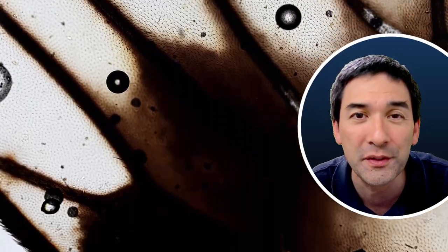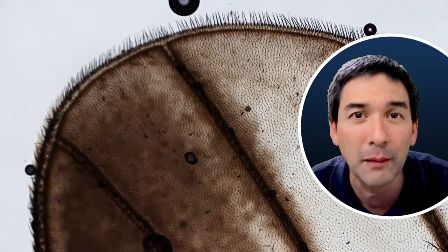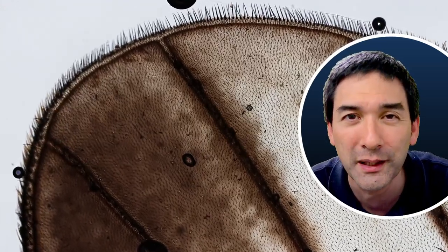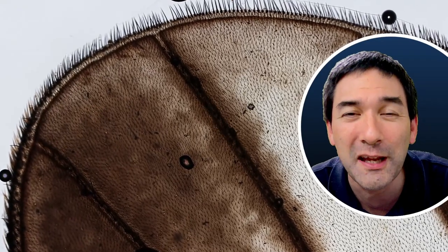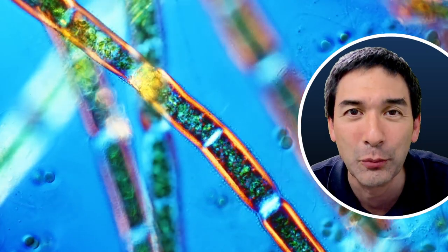Now under my compound microscope this is how it looks and you can see that there are still quite a few smaller bubbles visible. So all of the air could not be removed, but I think with a little bit more patience this is going to work and maybe I simply have to try a little bit more.